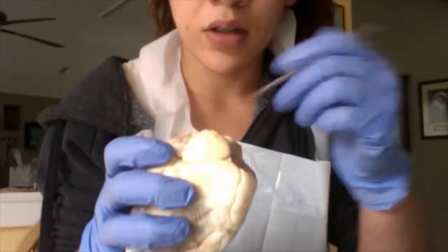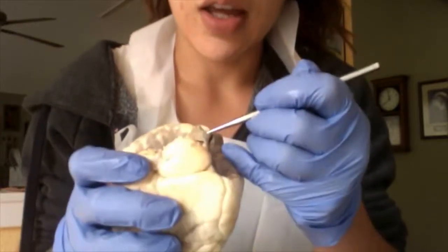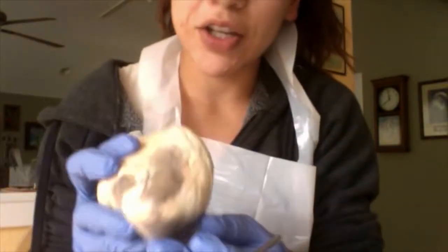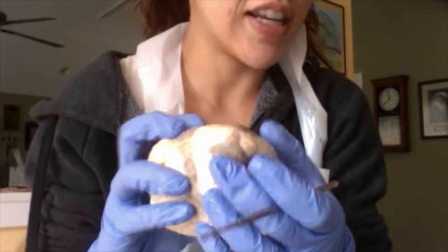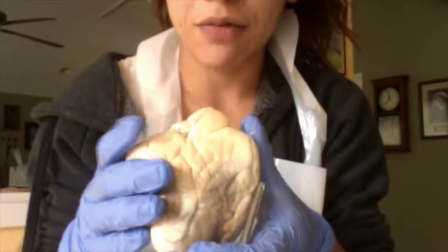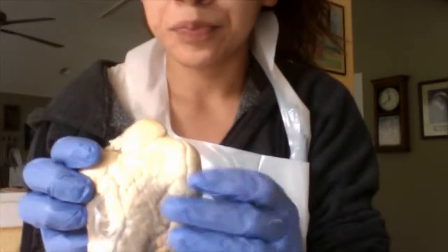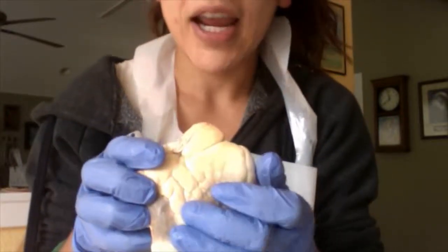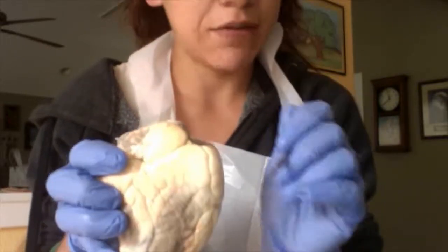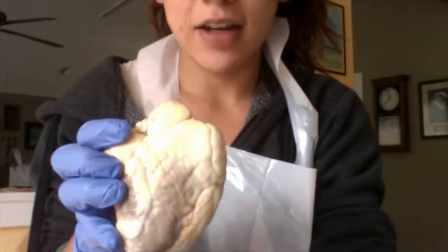So here, I would have the superior vena cava, which is where deoxygenated blood enters the heart. In this particular heart, you cannot see the inferior vena cava. Maybe when I go to dissect this guy in half, we'll be able to see it then. The coronary sinus receives blood from the left marginal vein and the left posterior ventricular vein, and it drains into the right atrium here. The coronary sinus is a vein, you note that, and the blood that it carries is deoxygenated.